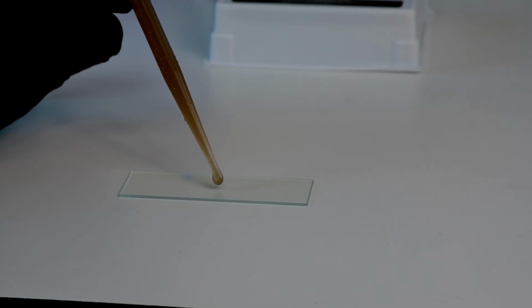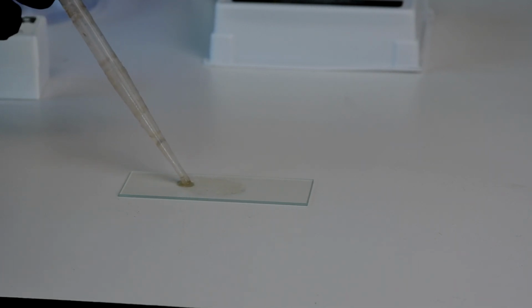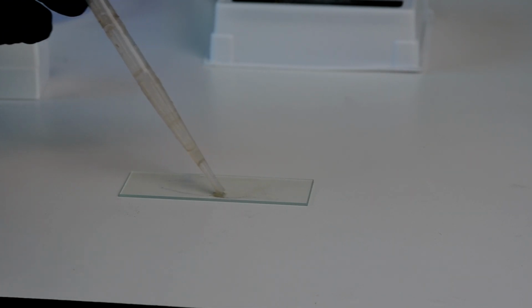And then I'm going to use the end of my transfer pipette. I'm just going to spread this around real evenly. I'm going to do the same thing here. Real even spread. You can do side to side, you can do circle patterns, it doesn't really matter.